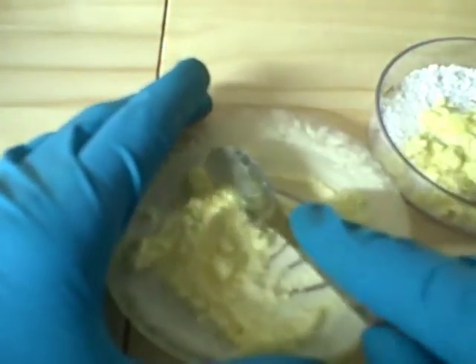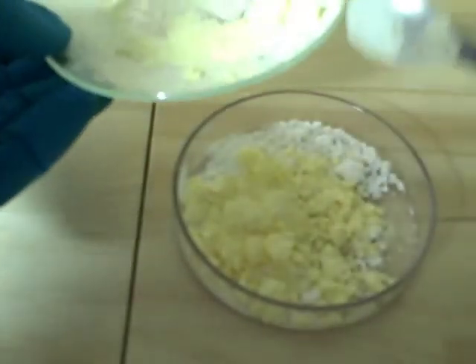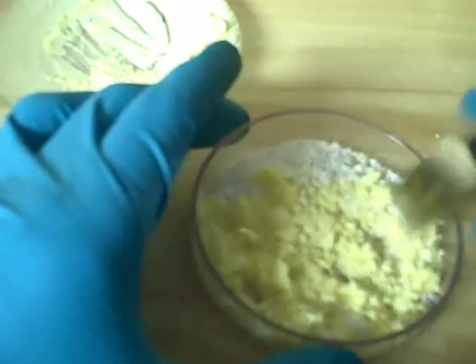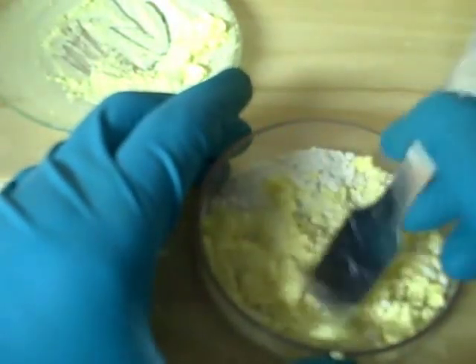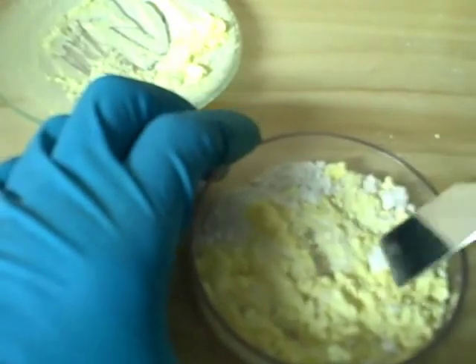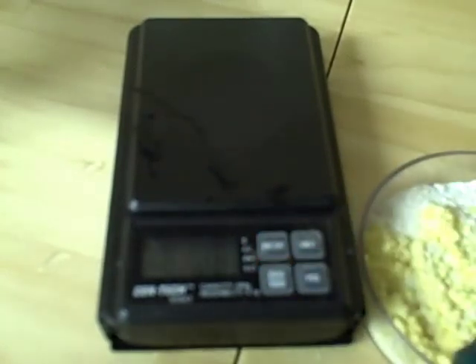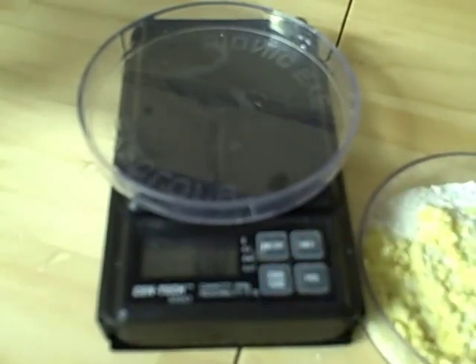And that's our sodium acetate — you can crush it up further, and if you have a mortar and pestle you can do that. Crush out all the large clumps because we're going to have to weigh this. I got my little scale out, we're going to turn it on, take the container that we're going to weigh it in, and we're going to tare it so it automatically goes to zero.